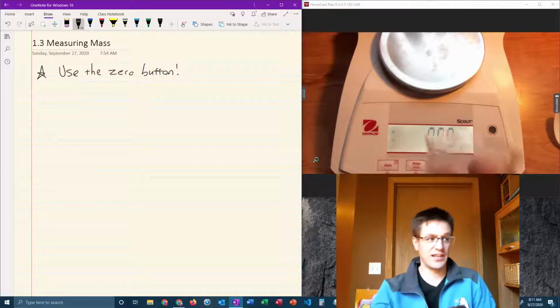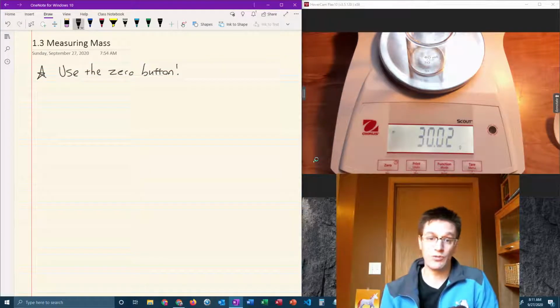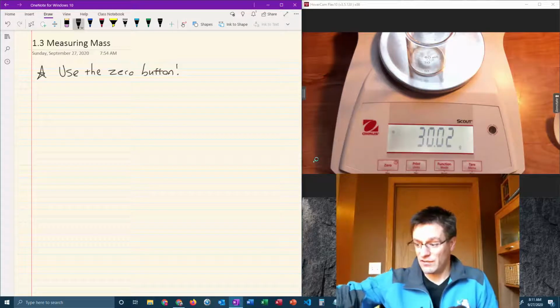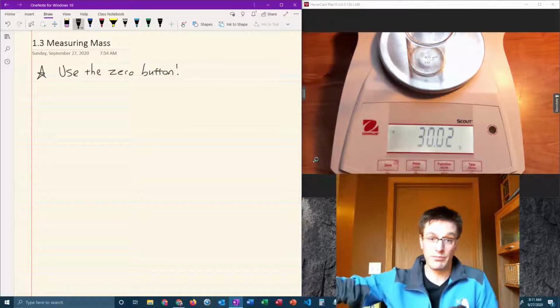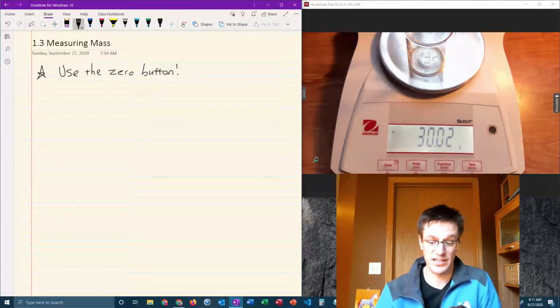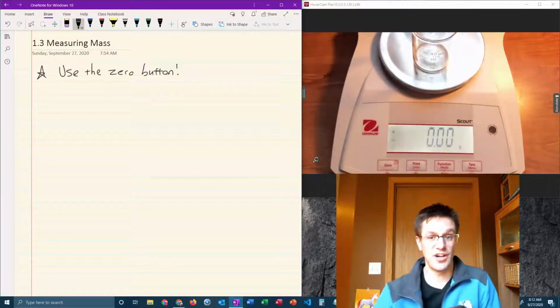And what it does is, say I put this beaker onto the balance, you can see it has a mass empty of 30.02 grams. So in a lab, I often see students struggling because maybe they need 1.5 grams of some substance, like I've got some sodium bicarbonate here, and they can't figure out how to get 1.5 grams because the mass of the beaker is on the scale already, and we don't want 1.5 grams of sodium bicarbonate plus beaker glass. We just want 1.5 grams of sodium bicarbonate without the beaker glass. So all you got to do is, with the beaker on the balance, press the 0 button, and now it will read 0 even with the beaker on the balance.